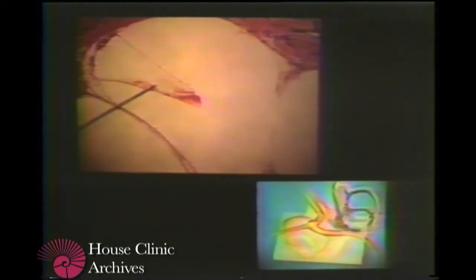the tectorial membrane, which normally rests on it but is usually displaced during the acts of preparation, the helicotrema, the stria vascularis, the spiral ligament, and the interscalar septum of bone. This is the horizontal portion of the facial nerve showing a rather large dehiscence in its osseous canal. We find this dehiscence present in at least 30% of temporal bones. The surgeon doing stapedectomy would be working in this area and might well injure the facial nerve unless he exercised great caution.